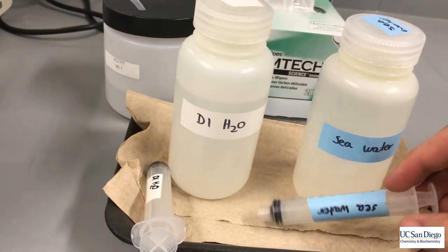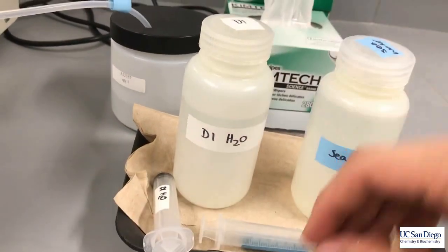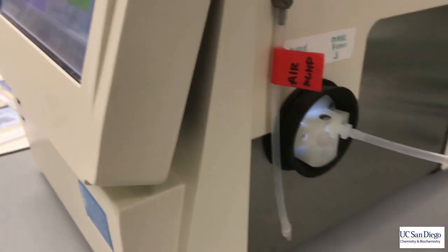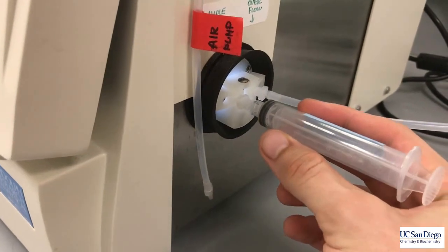There are syringes labeled for each sample — please do not mix these up. Additionally, you'll find the port for the sample.